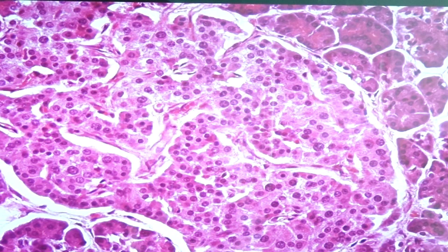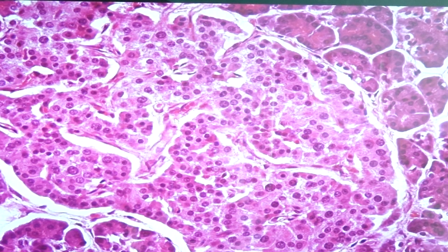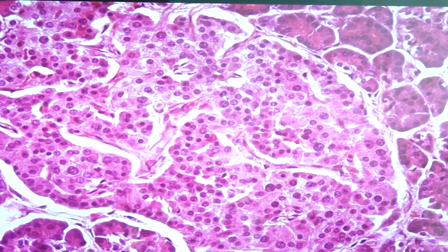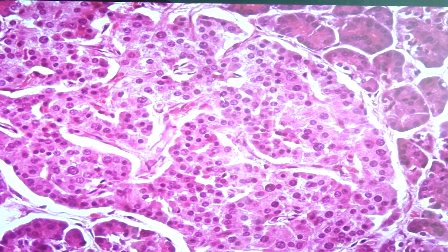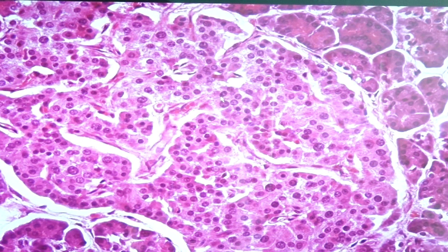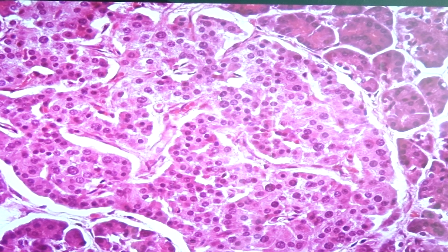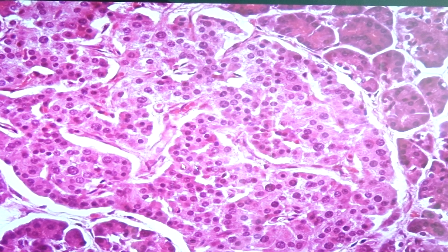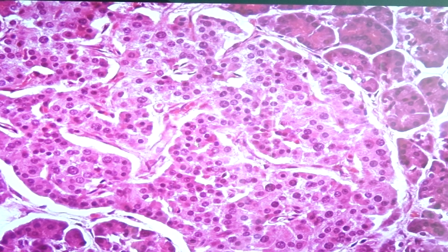With Mallory-Azan stain, the beta cell would have a brown-orange color, the alpha cell would color red, and the delta cell would color blue.